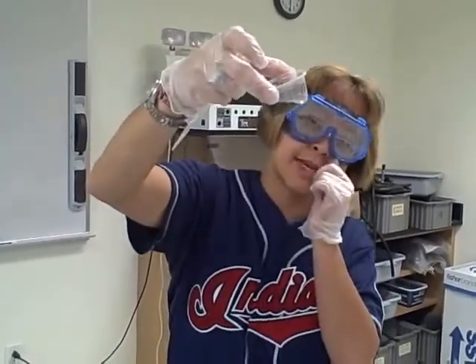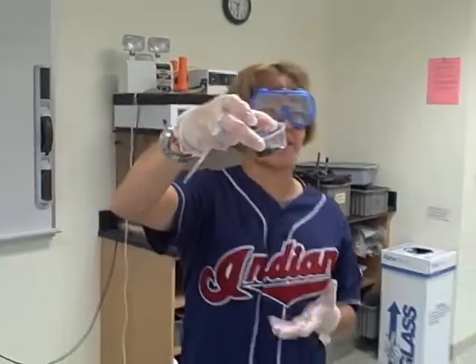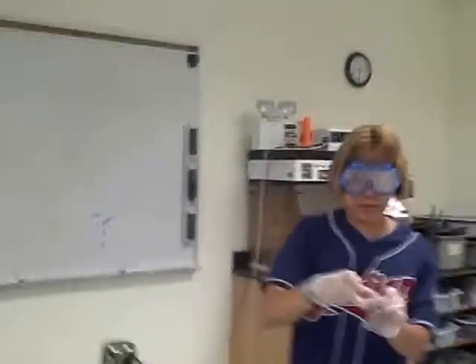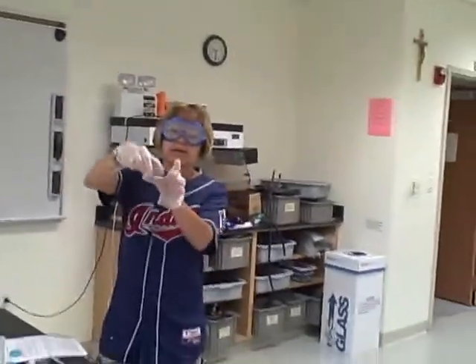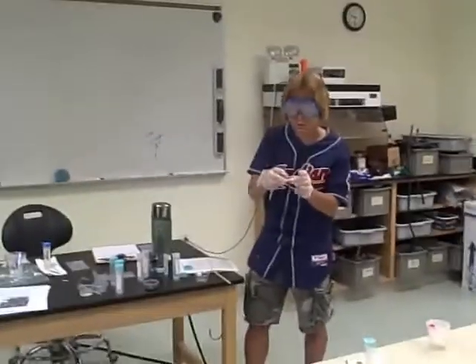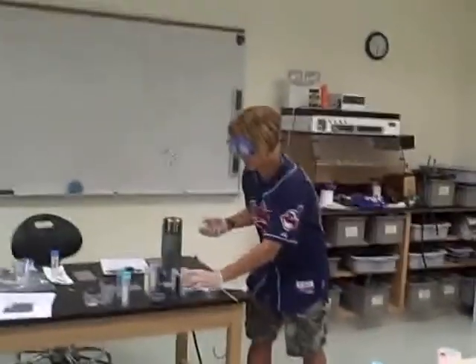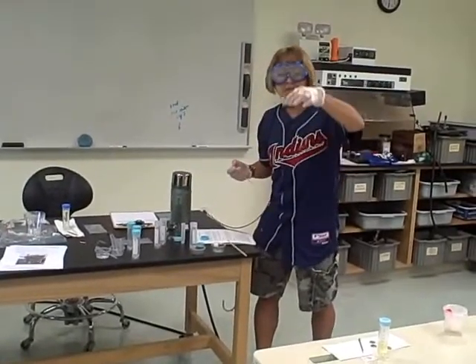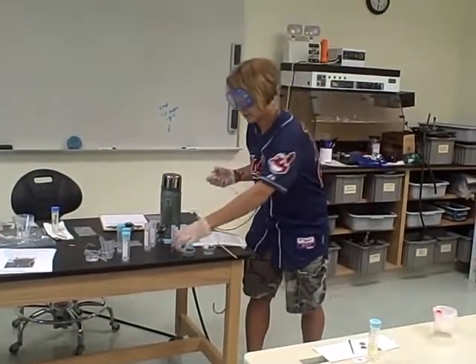This one's precipitating out because the concentration of the copper is lower than what we originally thought was going to happen, but you can sort of see the yellowish color here. The black is precipitating because there's simply too much reductant here, whereas the cobalt is more of a gray color and it's staying in solution.